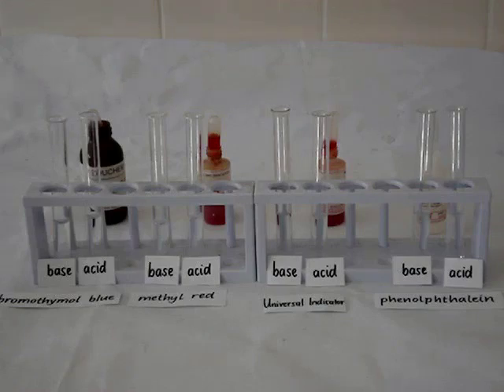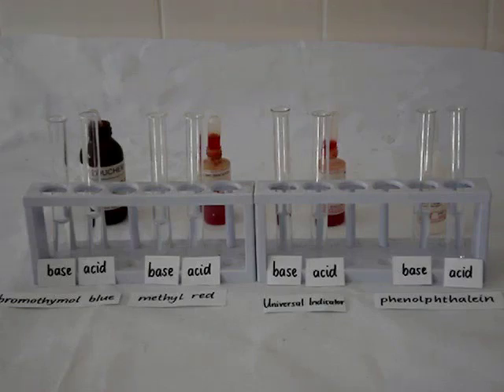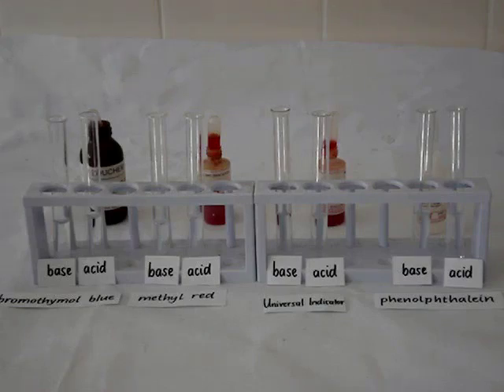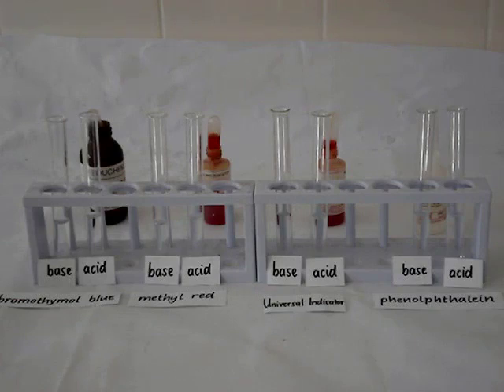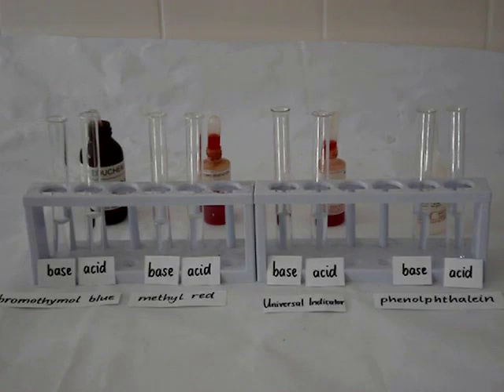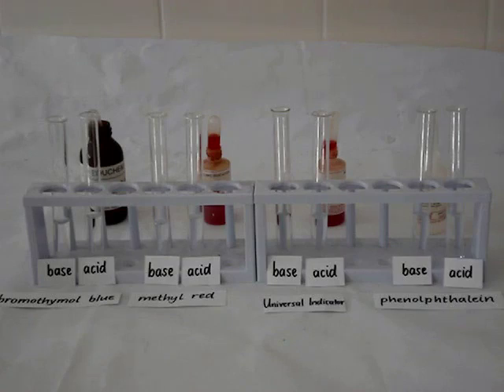Indicators show us whether a substance is basic or acidic. Here we have four indicators which we're going to use. We're going to add each one to a basic substance and to an acidic one, and we're going to see what color each one turns in each of those.